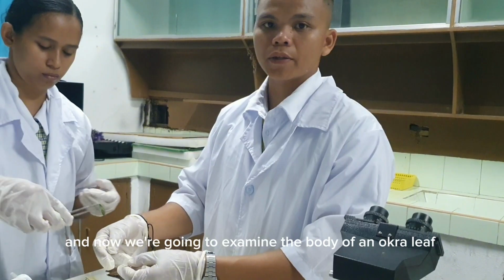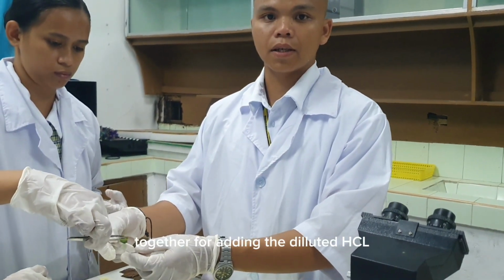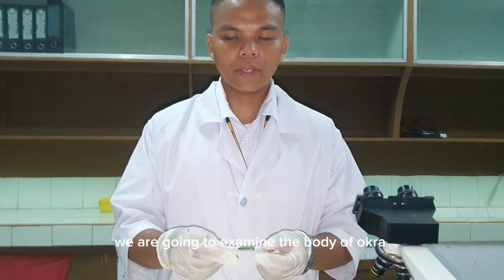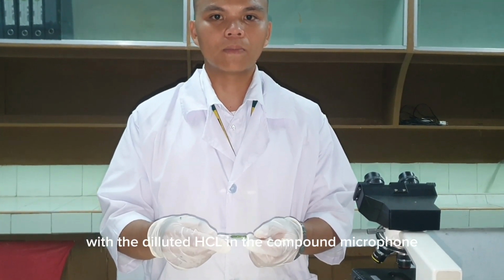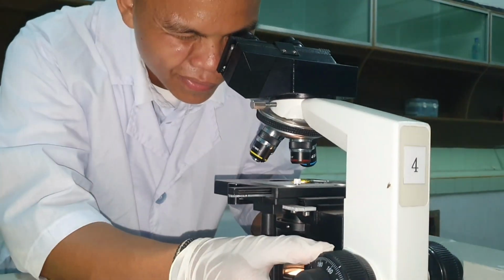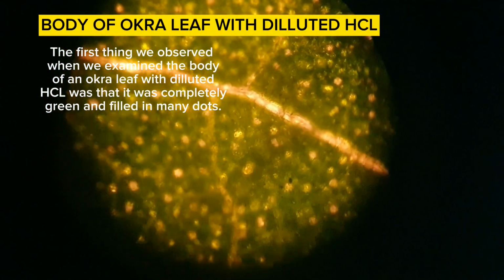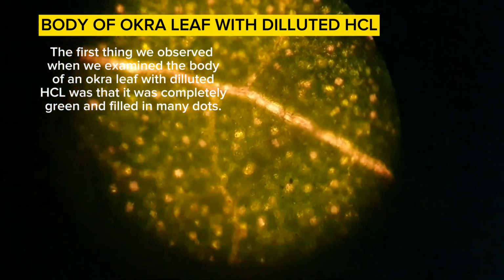Now we're going to examine the body of the okra with the diluted HCl in the compound microscope. The first thing we observed was that it was completely green and filled with many dots.